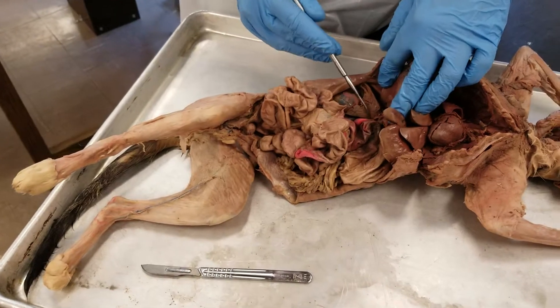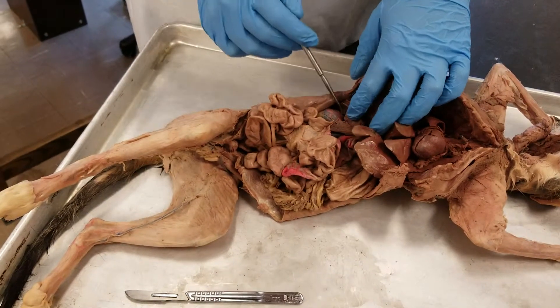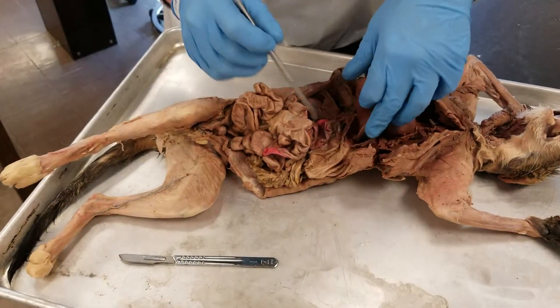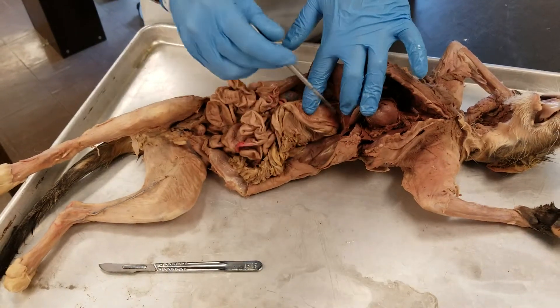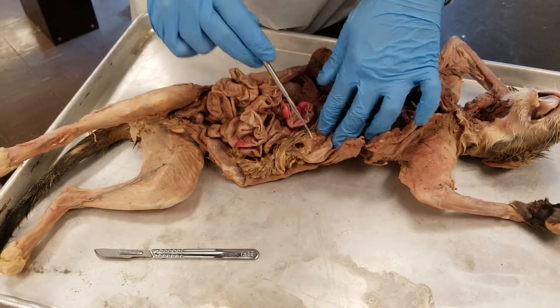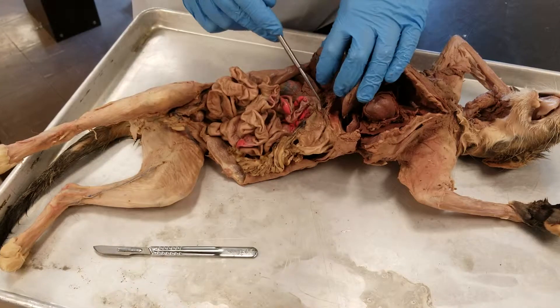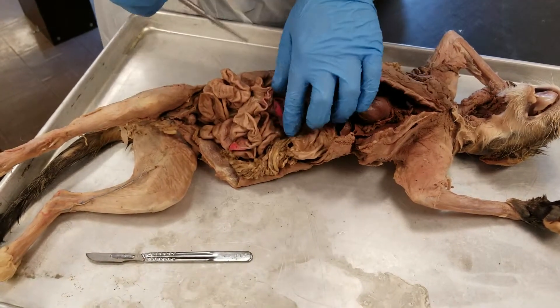Moving on, we are going to the esophagus, directly where it connects to the stomach, which is here. Up at the top we have the fundus, the body, which is the main portion of the stomach. Down at the bottom is the pylorus. Right here is the pyloric sphincter, where the stomach connects to the small intestine.